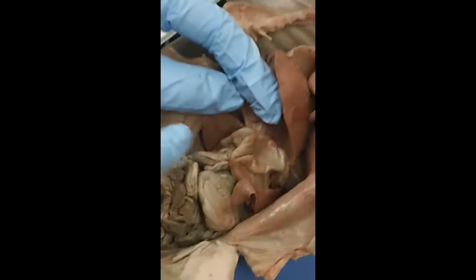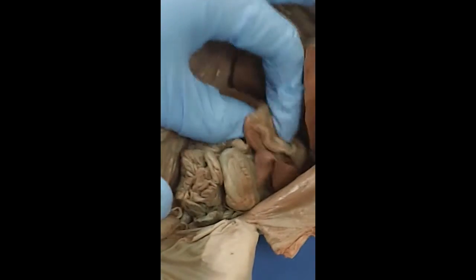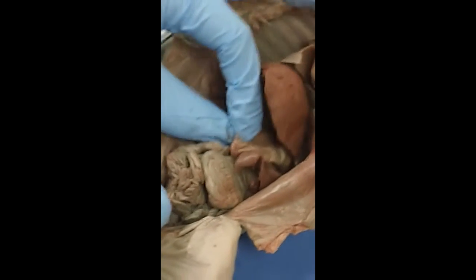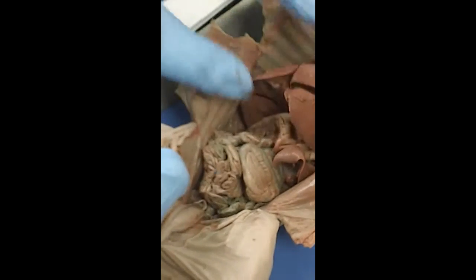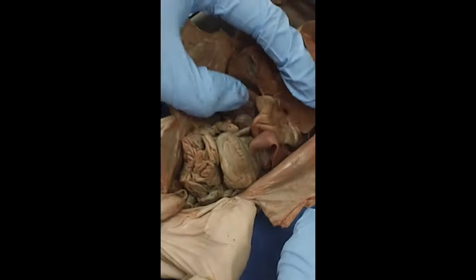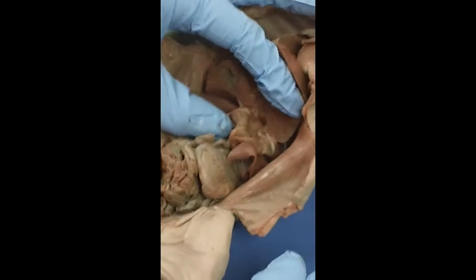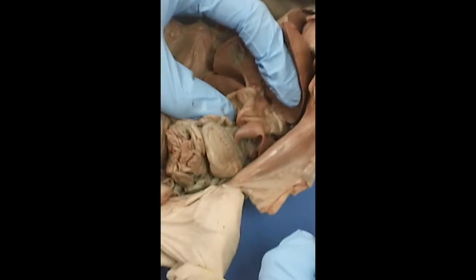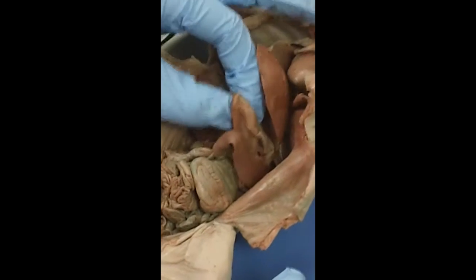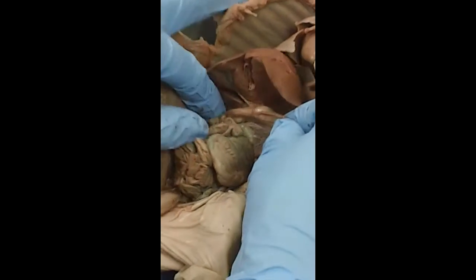Also in the abdomen is the stomach, and here's the stomach. The stomach is under basically the left lobe of the liver. Remember that you have to be the pig, so your right is the pig's left. So this is the stomach, and the stomach is a big muscular bag, and it accepts the food and churns the food and adds chemicals to the food to do chemical and mechanical digestion of the food. When the food leaves the stomach, it goes to the small intestine.